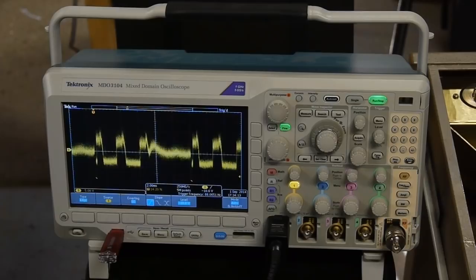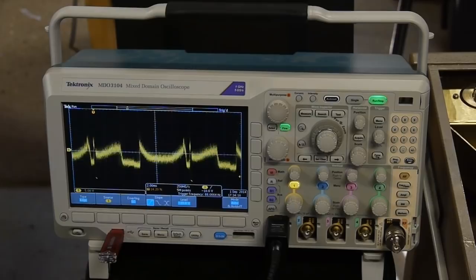And you can see that there's a negative pulse here and a negative pulse here, which is what I'm triggering off of. And these are the horizontal sync pulses.